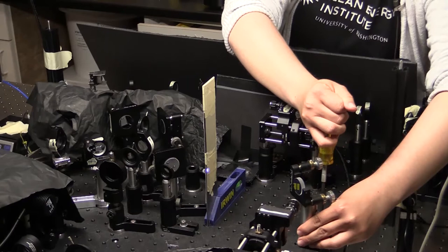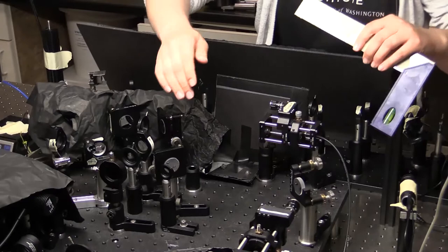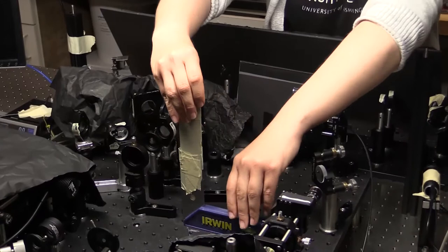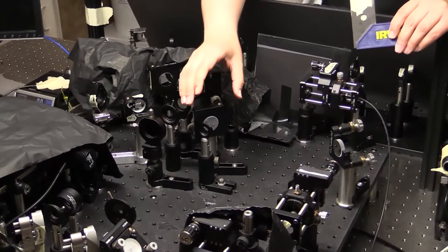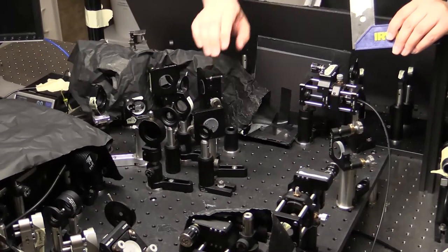Sometimes the beam will move when you clamp down, so make sure you're paying attention that it doesn't leave your system. Once I've set up the first mirror, I then repeat the same process for the second mirror, this time making sure it goes along this line of holes. I choose two locations to make sure I can know how to twist it and how to translate it. And if it's not hitting the center of the mirror, I can also translate my mirror in the direction parallel to the mirror face without adjusting my alignment.